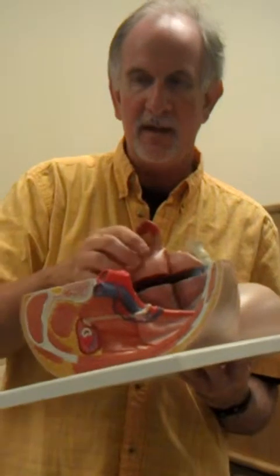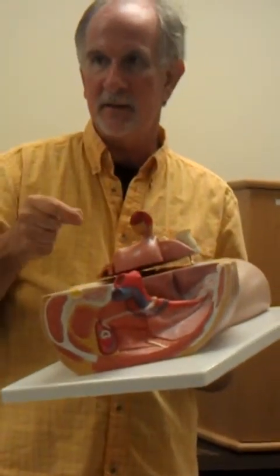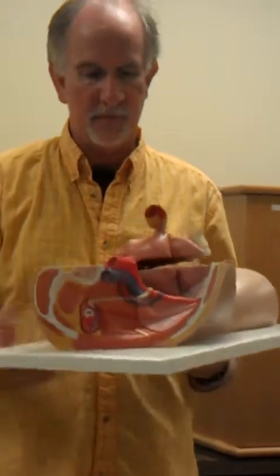The other thing that looks like a round thing is the ovarian ligament. That's going to attach the ovary to the side of the uterus. So there's only one oviduct, and the second tube-like structure is solid and called the ovarian ligament, and it helps to attach the ovary to the side of the uterus, so it won't flop around as much.